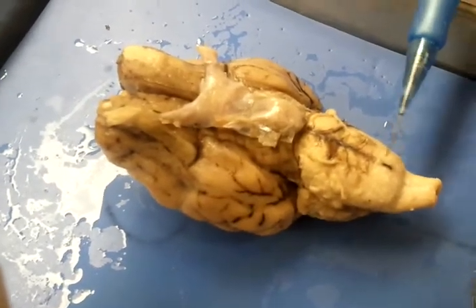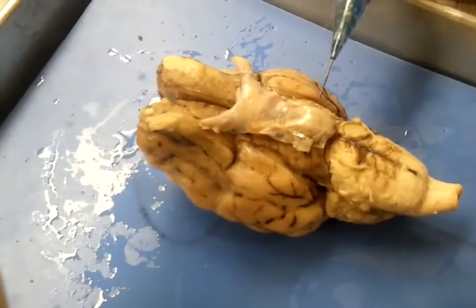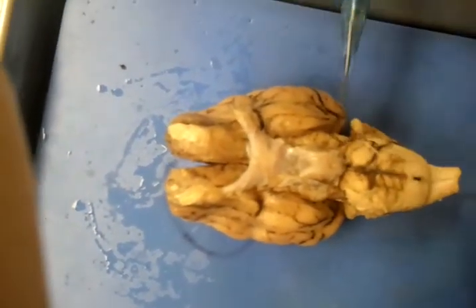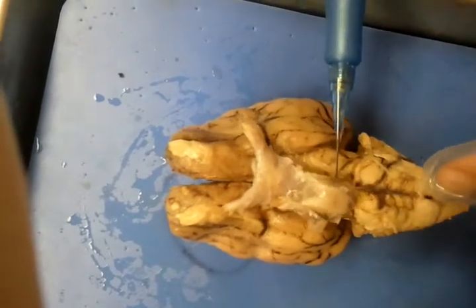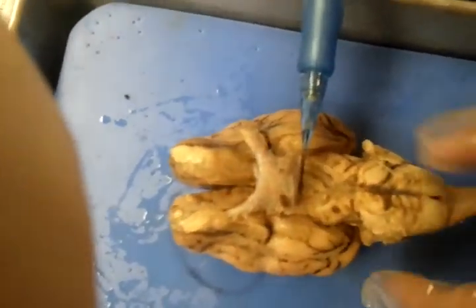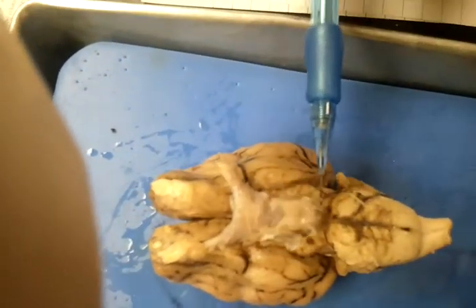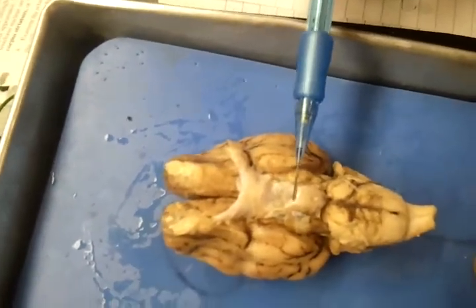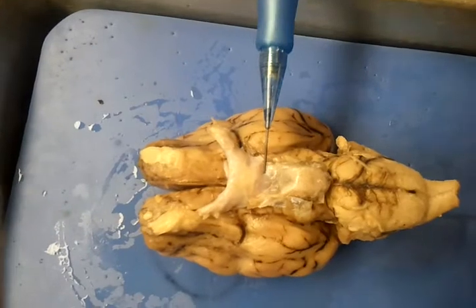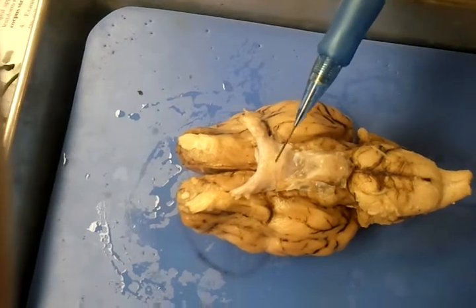And then we also have, back again, the medulla oblongata. And we go to this side over here, where we have the cerebellum, which is right here. And then we also have the pons, which is located right in there. And then we also have, this is called the cerebral peduncle, which is right here. And then we also have the optic chiasma, which is right here in this area.